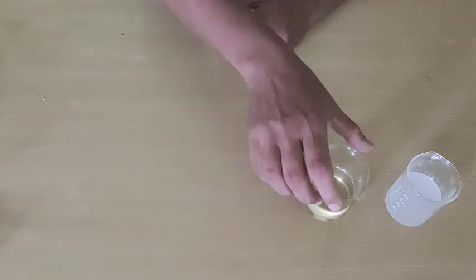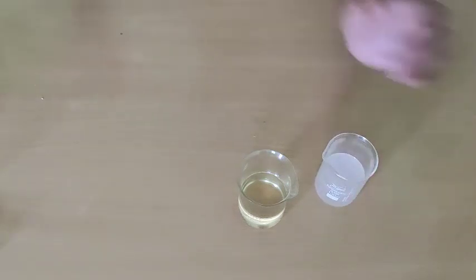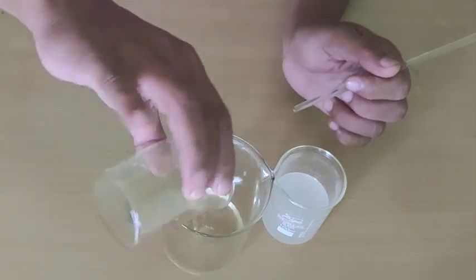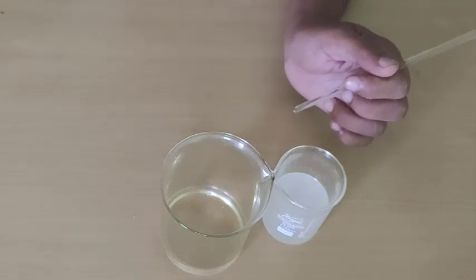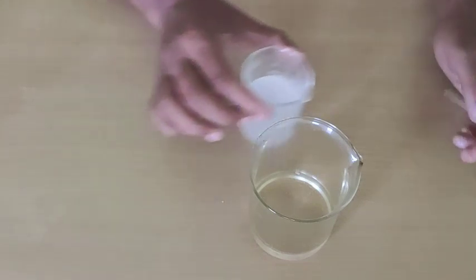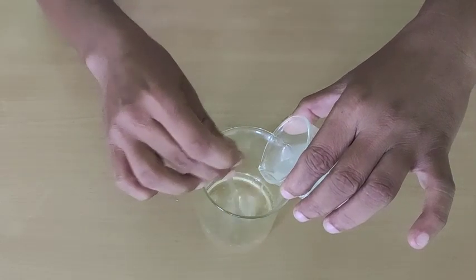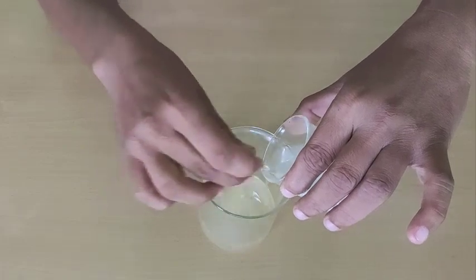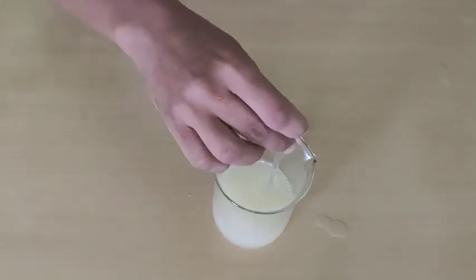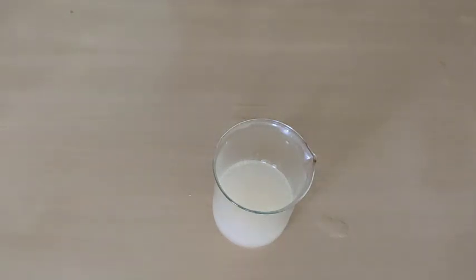Now we will add this sodium hydroxide solution into the oil. For this we will need another larger beaker. In this beaker I will pour the oil, and then I will pour in the sodium hydroxide solution — it is hot, so we will hold it carefully. While pouring you have to stir the solution continuously. Now this mixture of oil and sodium hydroxide is ready and we will heat this solution.